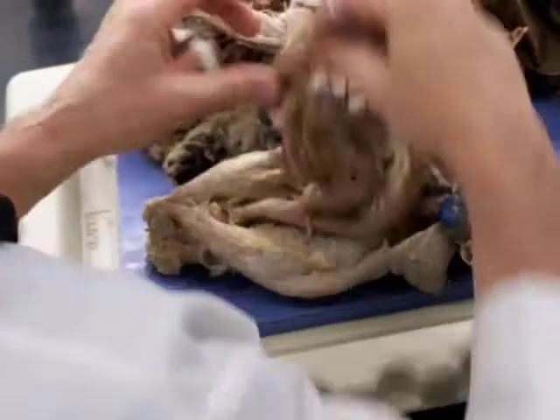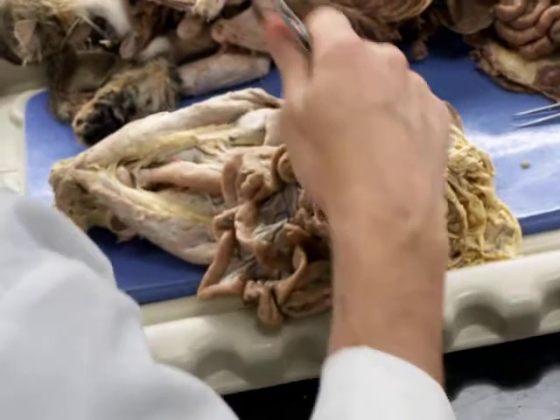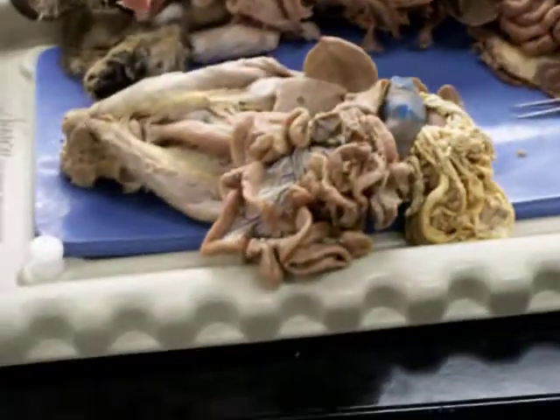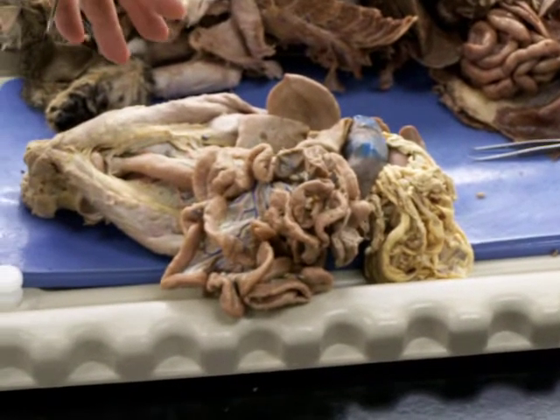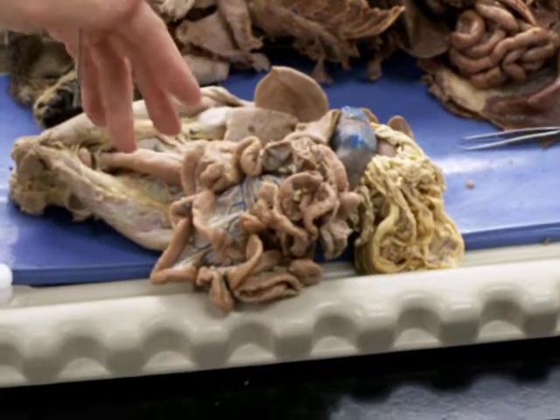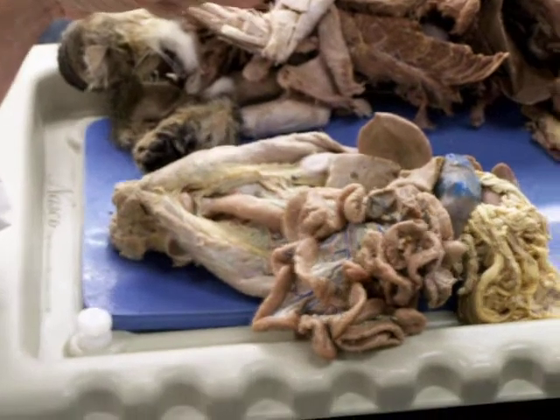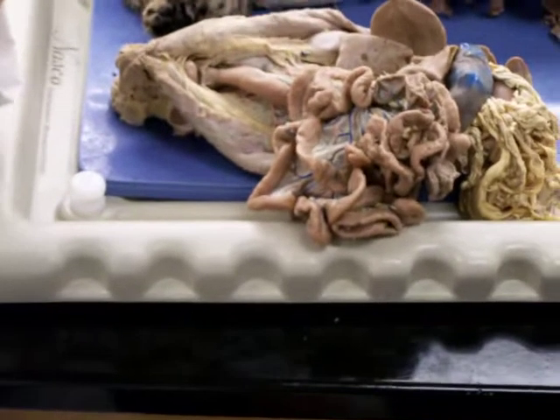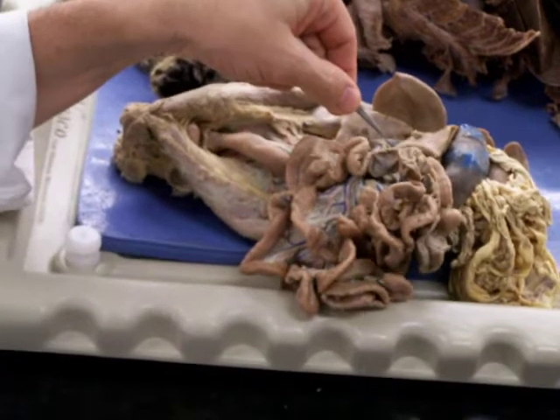Okay. Now the veins in this, the veins that are illustrated or labeled, there are two sets of veins in the digestive tract. There is the hepatic portal vein, and then there are also somatic veins or systemic veins. And by far the most prominent are the hepatic portal system. That doesn't get injected in your cats, and so you can't see those. Those are usually just clear tubes or look like just thickenings of the connective tissue. In these, the hepatic portal's been injected.